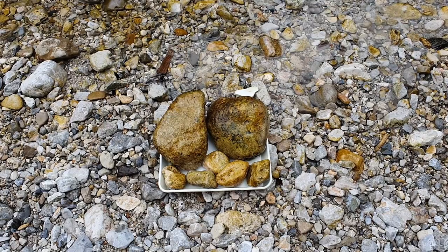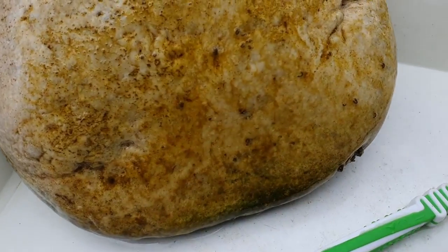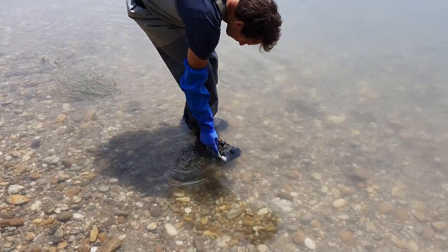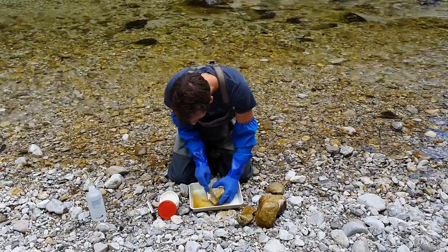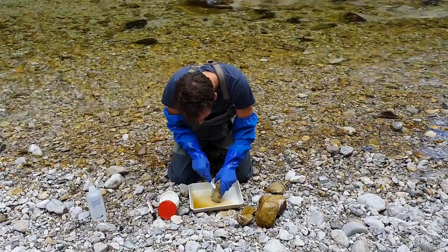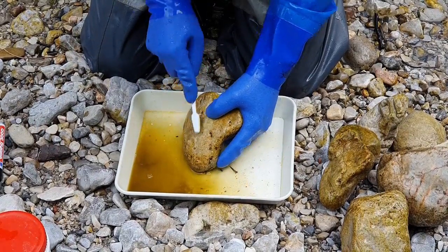When cobbles or bigger stones are not available, a minimum of 10 pebbles can also be sampled instead. The diatom biofilm can be removed from the substrate by using a toothbrush or a knife. The toothbrush should be carefully washed in clean river water and rubbed on a clean surface before and after each sampling to minimize any diatom contamination from previous samples. Brush the upper surface of the substrate vigorously to remove the diatom film, rinsing the toothbrush periodically in the water to transfer the diatoms. An area of approximately 10 square centimeters or more should be carefully brushed. Only the upper side of stones exposed to flowing water should be scrubbed to avoid contamination with sediment.